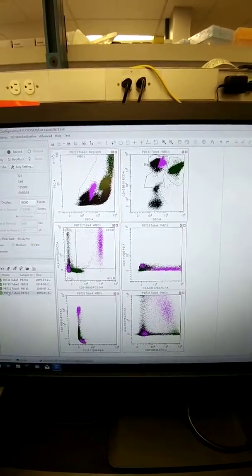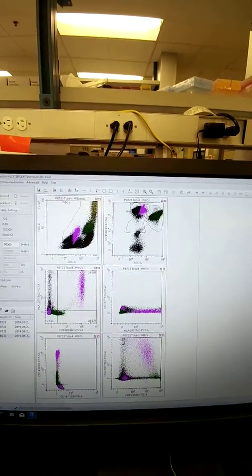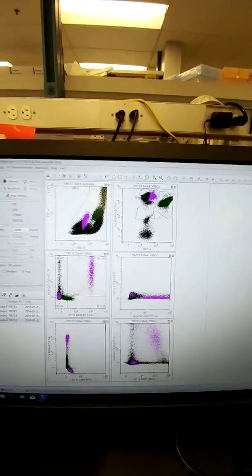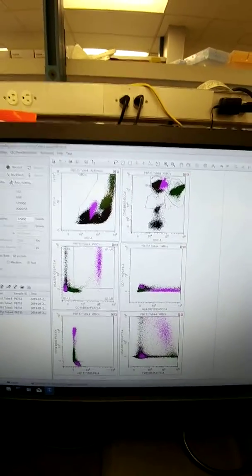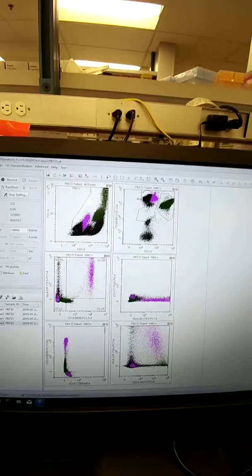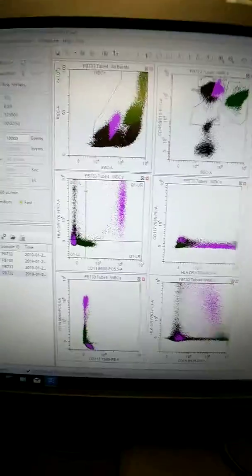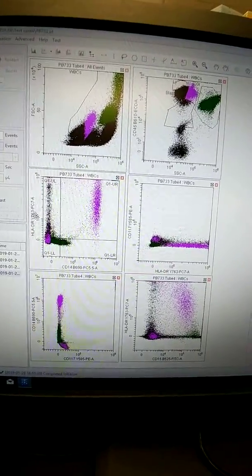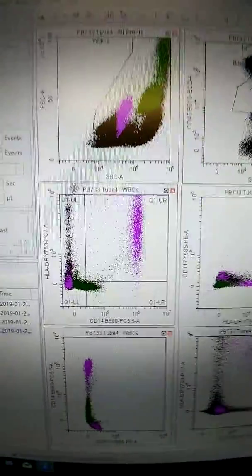But I know when we were there before and ran some samples, Steve looked at the data and he said that some of the gains looked like they were too high and he wanted me to bring those down. And I was working on that when we had to leave and I never quite finished and saved that for y'all. So what he means is, like on this one, I ran a sample today and looking at the HLADR PC7, you can see that it goes up here and it looks like it might be cutting some of it off. So that he decided is too bright.